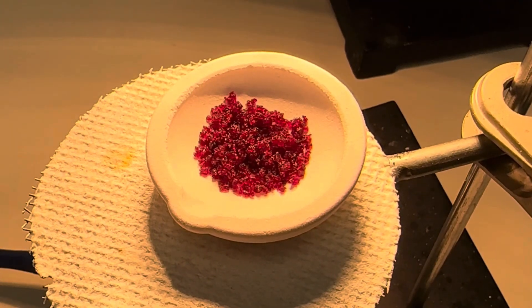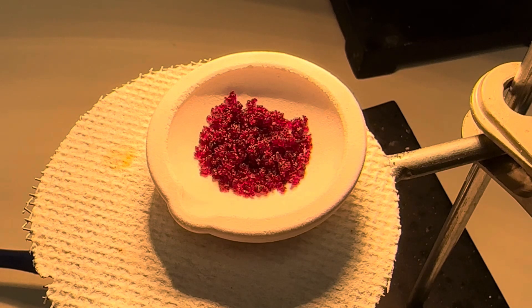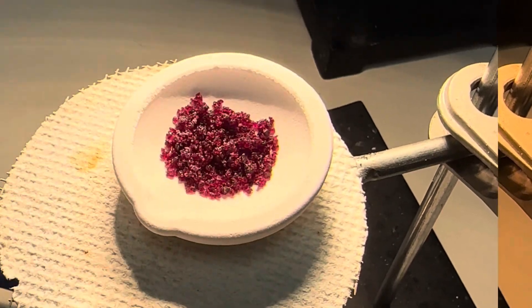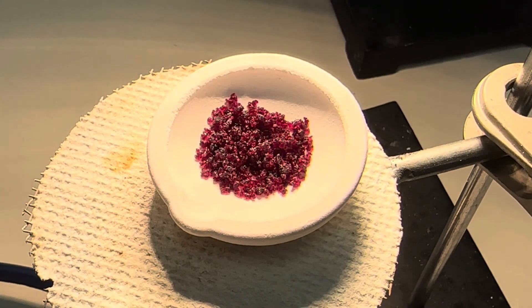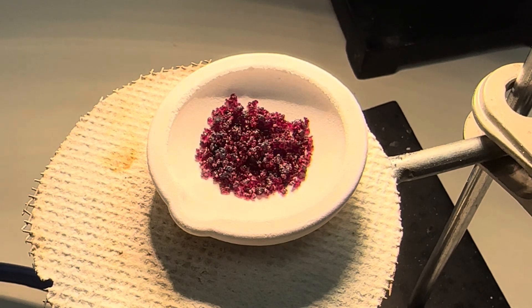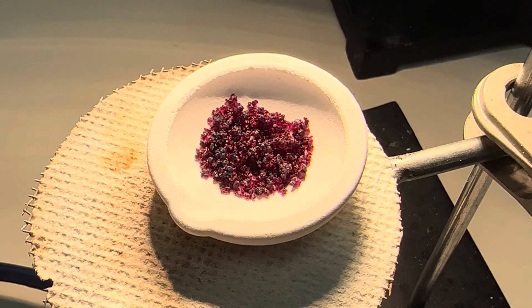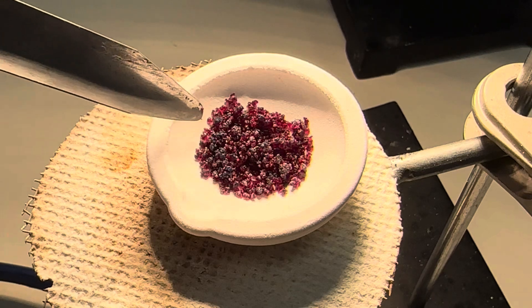And once again, it's hydrated. Let's try the same reaction again. This time, we'll use a white crucible so you can really see the pink color change to a blue. Here again, we're starting to heat our cobalt-2-chloride hexahydrate, and you'll start to see it turn to a deep blue as it loses those water molecules. You can see it turning colors right along the edges.